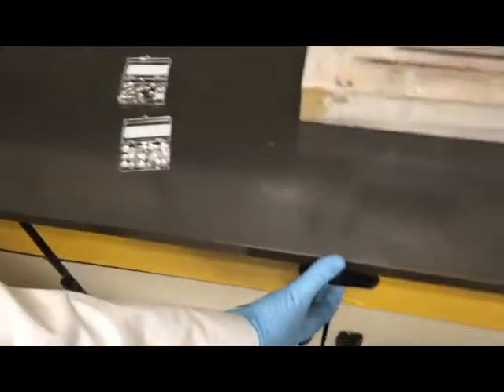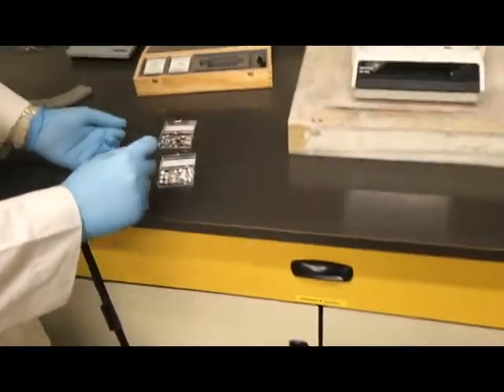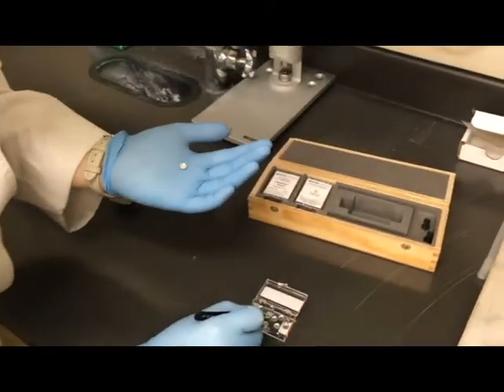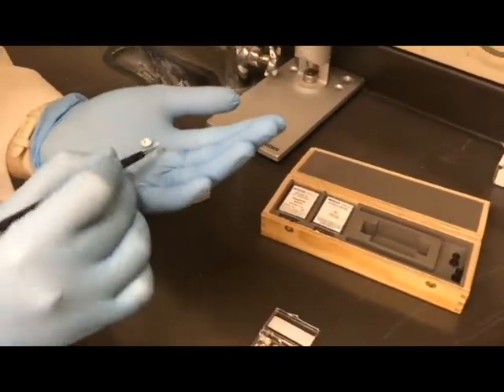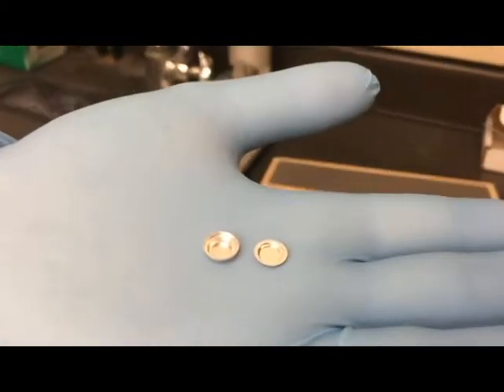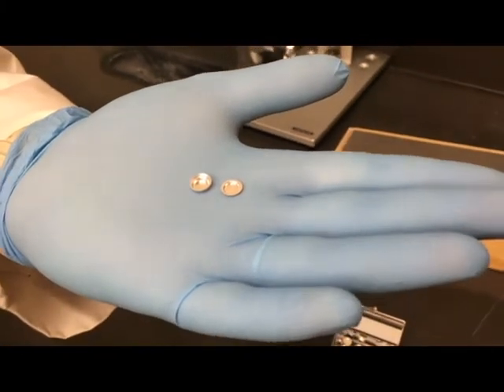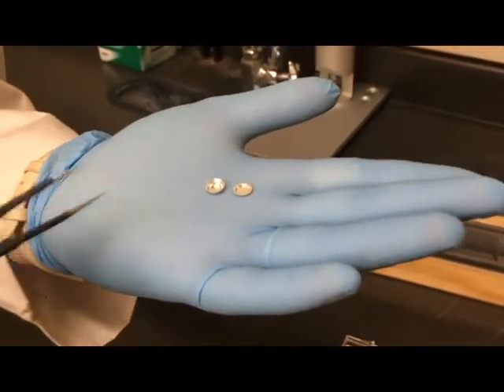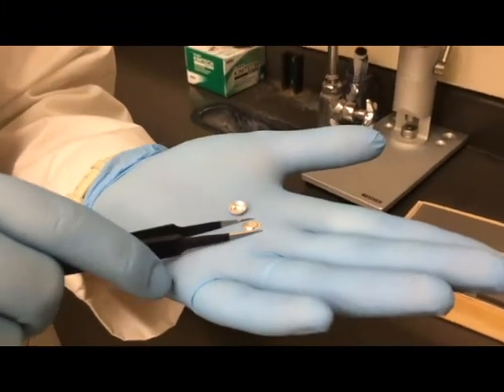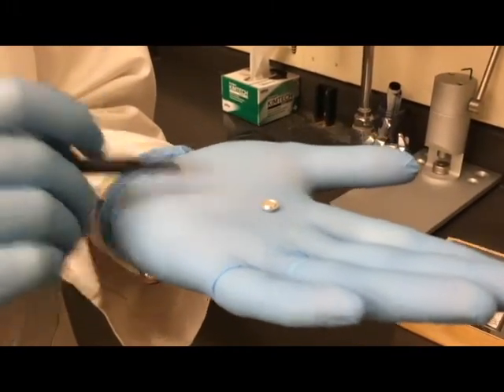In the drawer directly underneath us we've got a whole bunch of tweezers. I'm going to grab one crucible and one lid. The thing about these is they are basically just aluminum foil — really really easy to bend. They're very thin, so you want to be really careful as you're picking them up. I have bent many of these crucibles before. The lid goes on like a top hat and sits on the crucible, kind of sitting down inside that little lip.